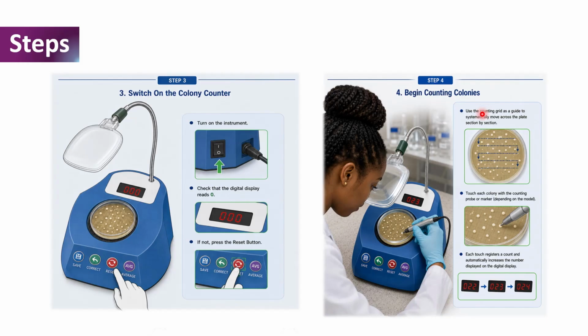And before we do this, we have to use the counting grid of the colony counter as a guide to systematically move across the plate section by section. So from this picture over here, this is the first section of our agar plate, the second section, third, fourth, fifth, and sixth, whenever we use the counting grid as a guide.